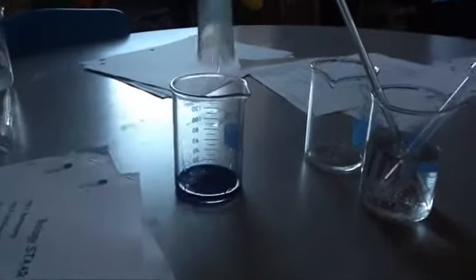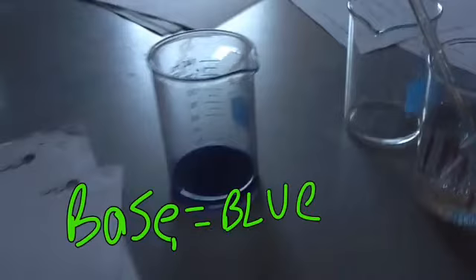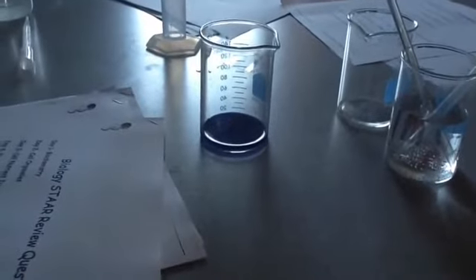Notice the color change, right? Purple, right? That's because the base has a color change a little bit.